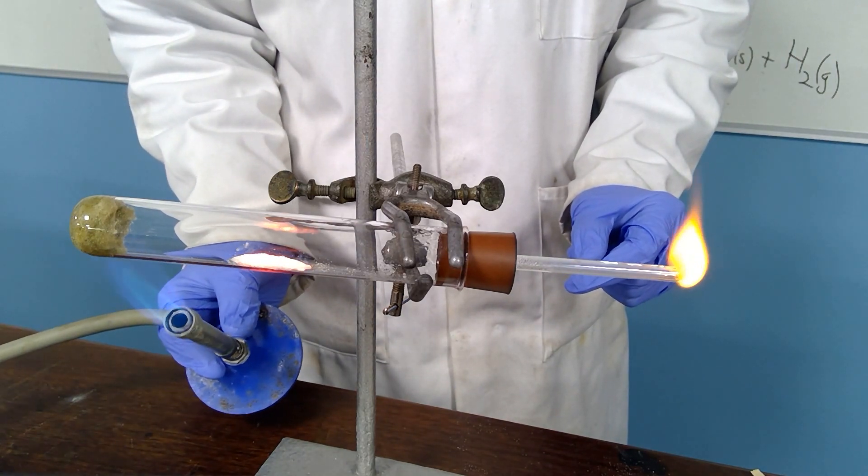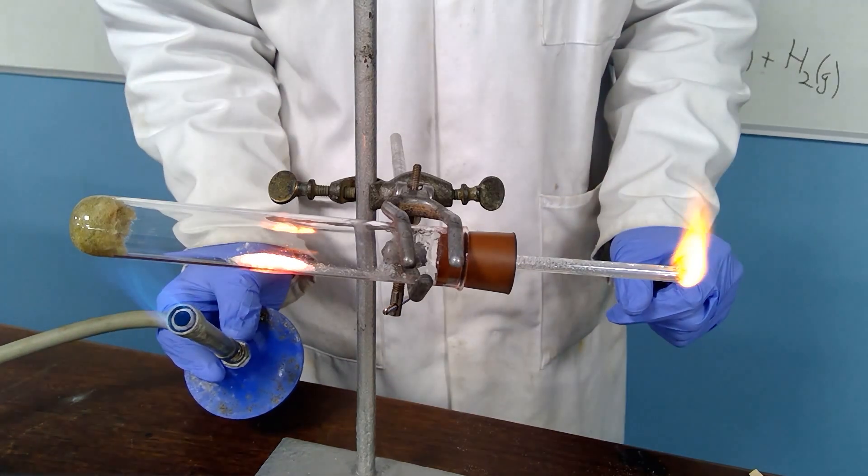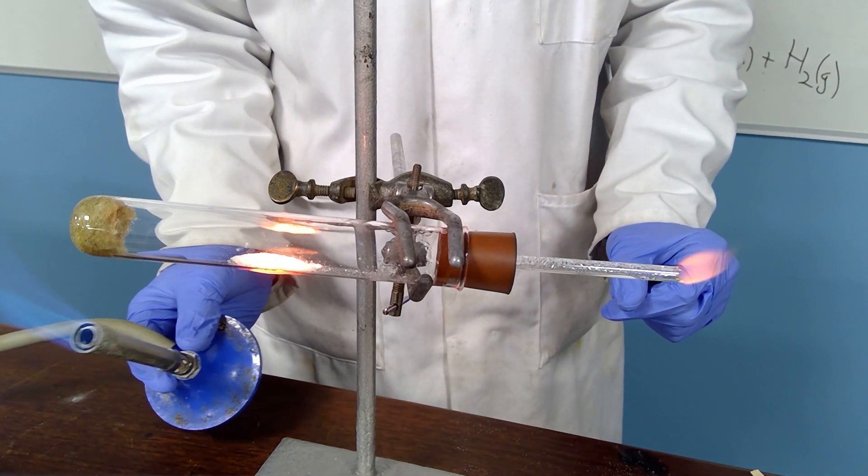Where the hydrogen is burning, you can also see some of the steam being condensed there into water because it's obviously cooler along here. Again, I can make the flame a little bit larger.